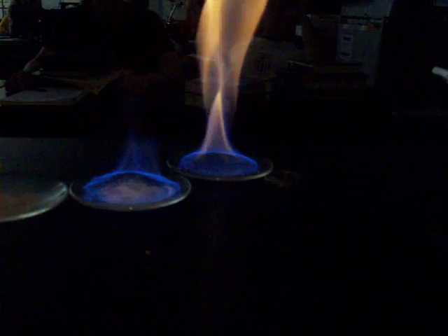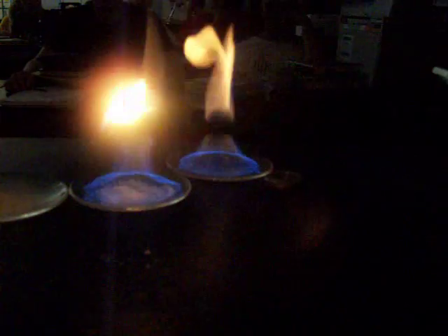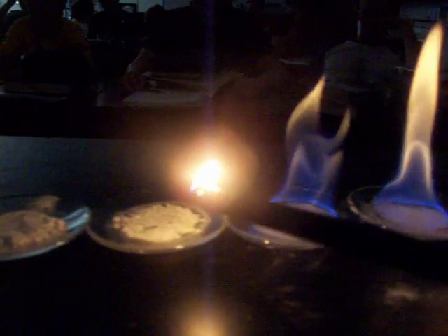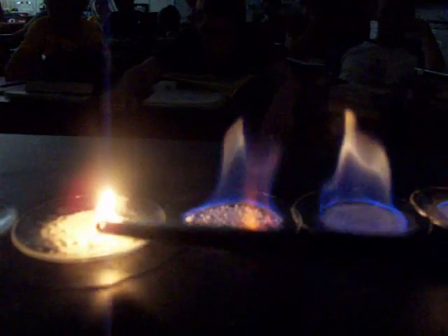We can kind of compare the colors together. Starting out we have the alcohol flame, and then we're going to have the lithium with its pink color, the sodium, next is potassium, then calcium, strontium, copper, and boron.